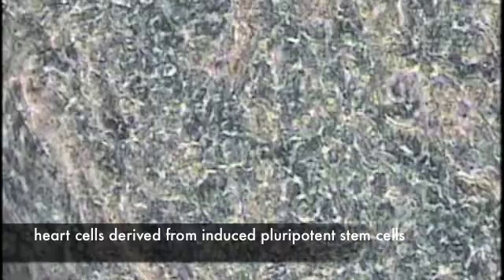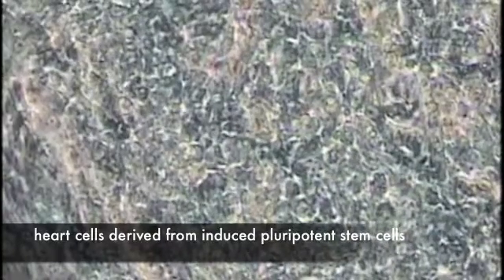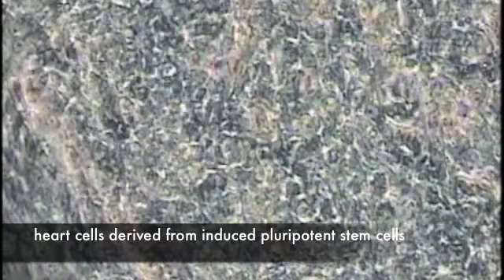And here is a similar patch of beating heart muscle tissue from differentiated mouse induced pluripotent stem cells. In our hands, the timing and efficiency of cardiac myocyte production using the stem cells from the adult mouse are equivalent to the yield from mouse embryonic stem cells.